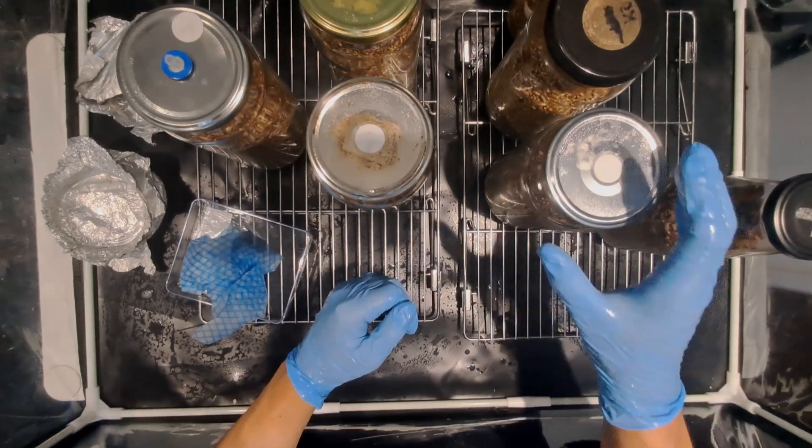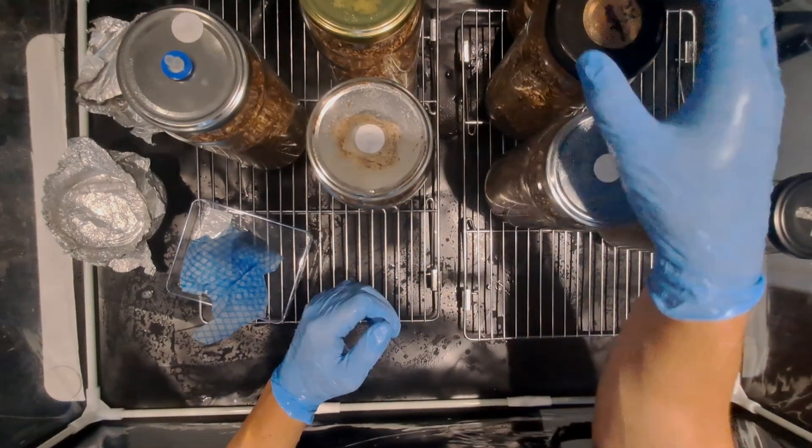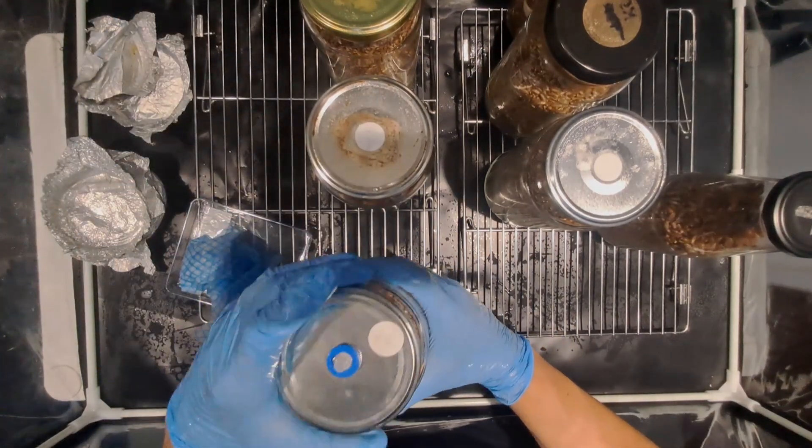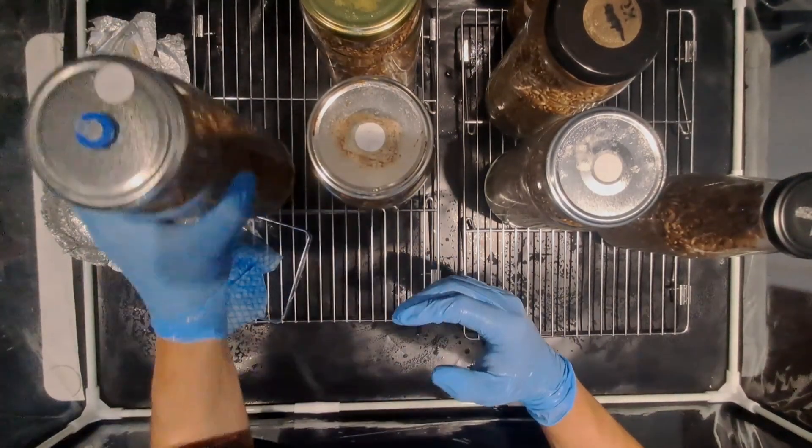I'm just doing one last check here before inoculation and I don't want to start picking that jar up while my hands were soaked in alcohol.